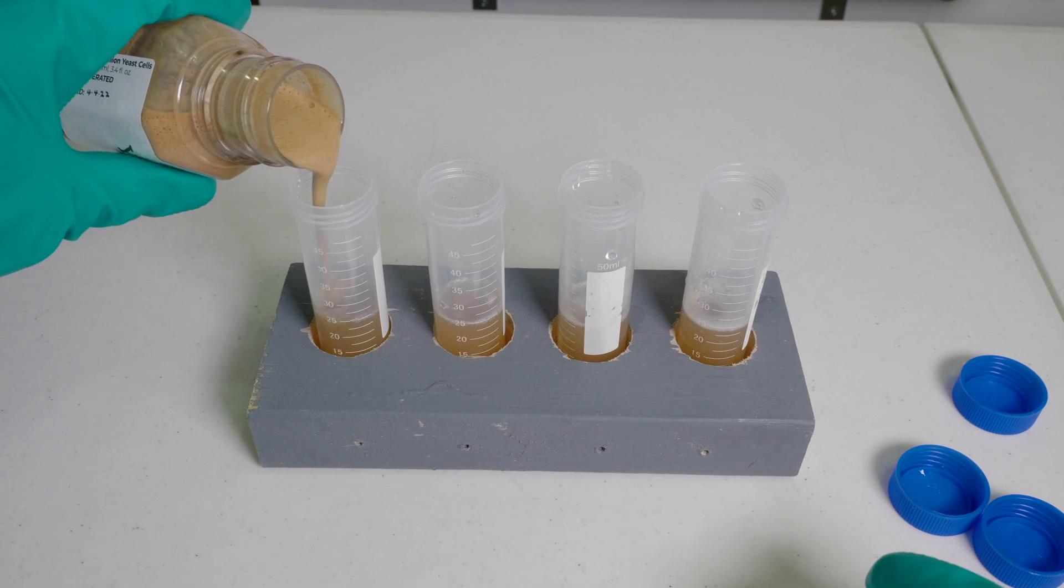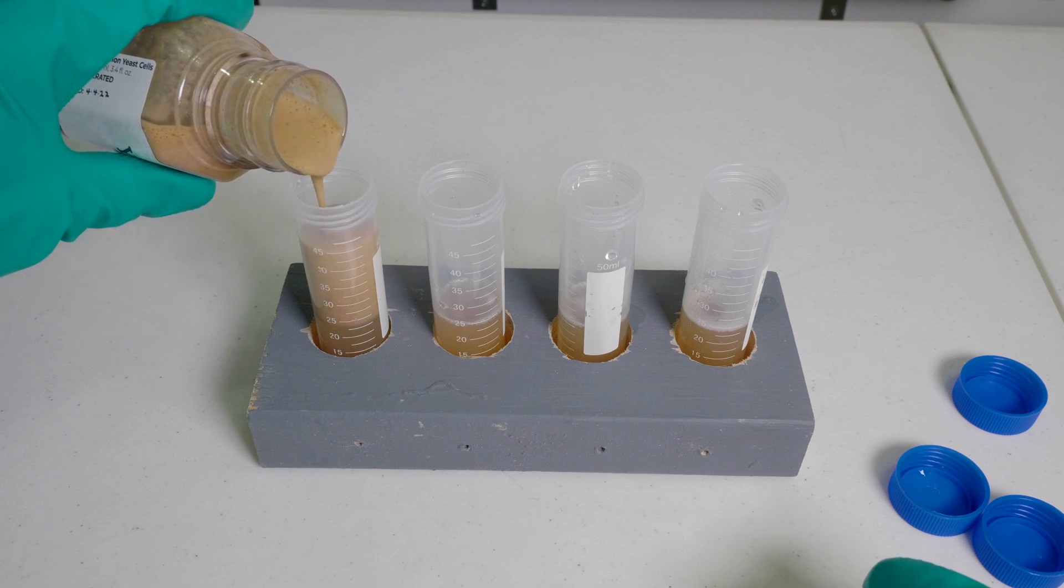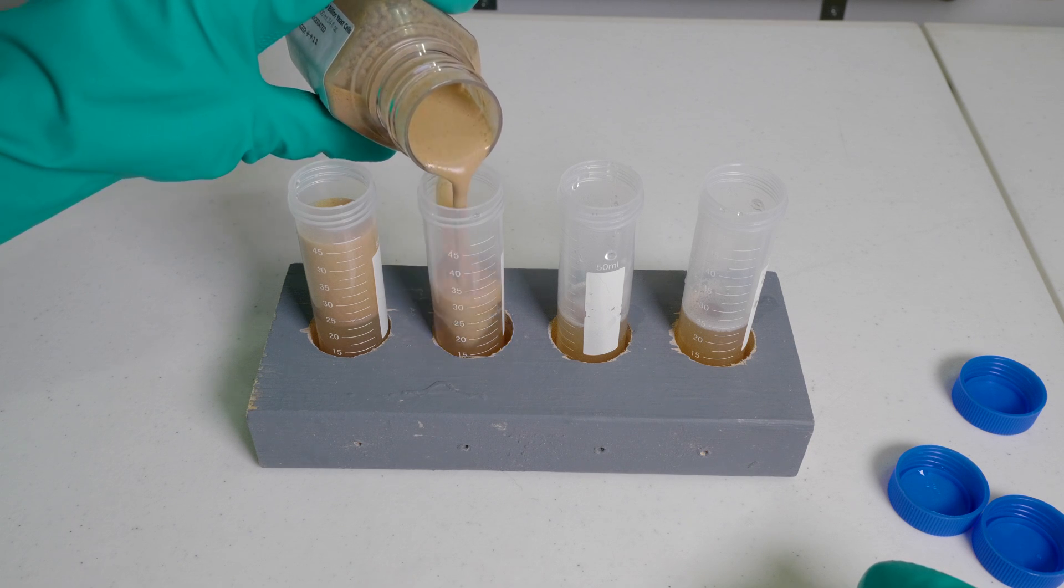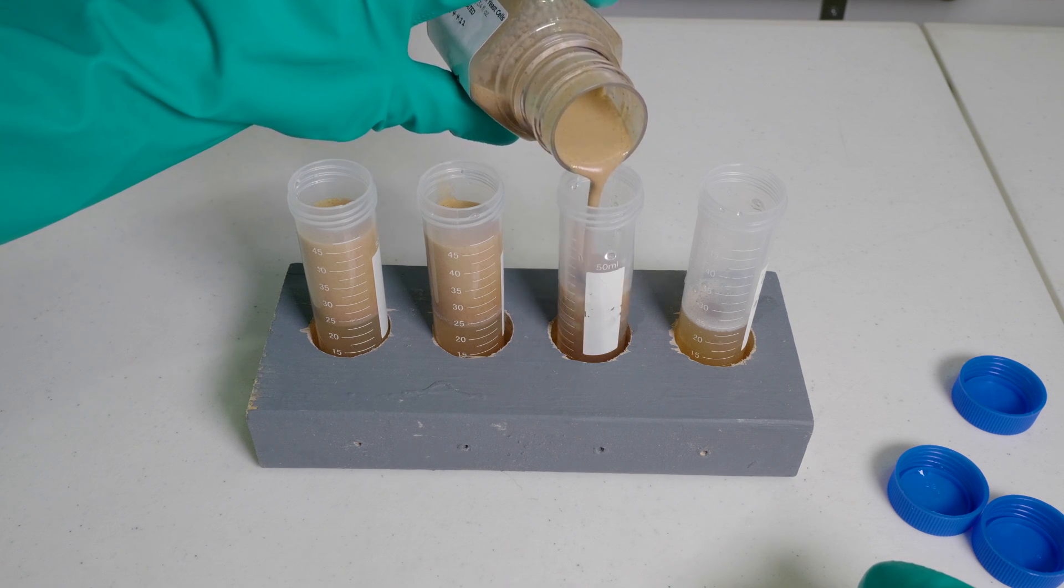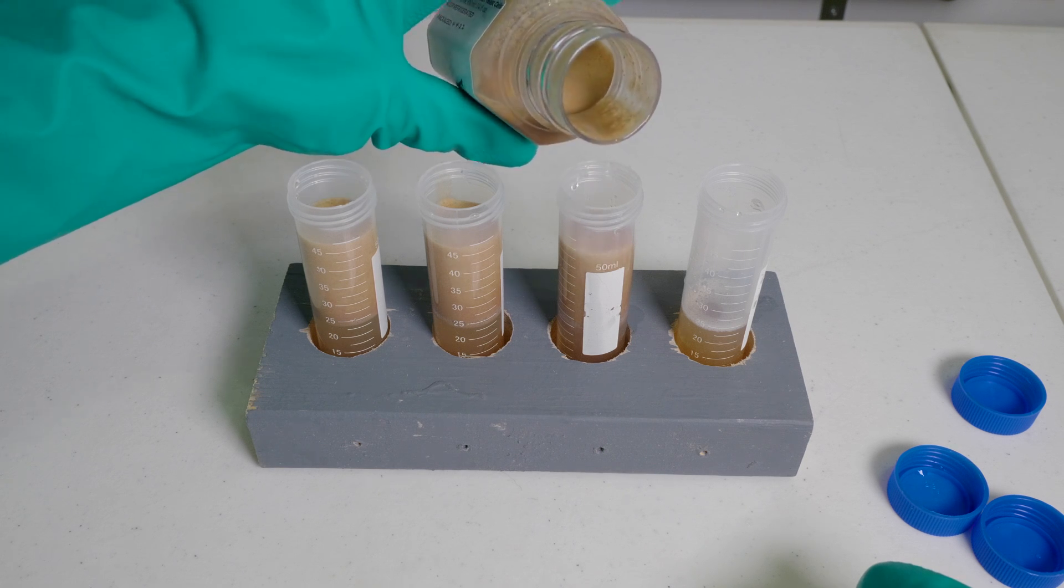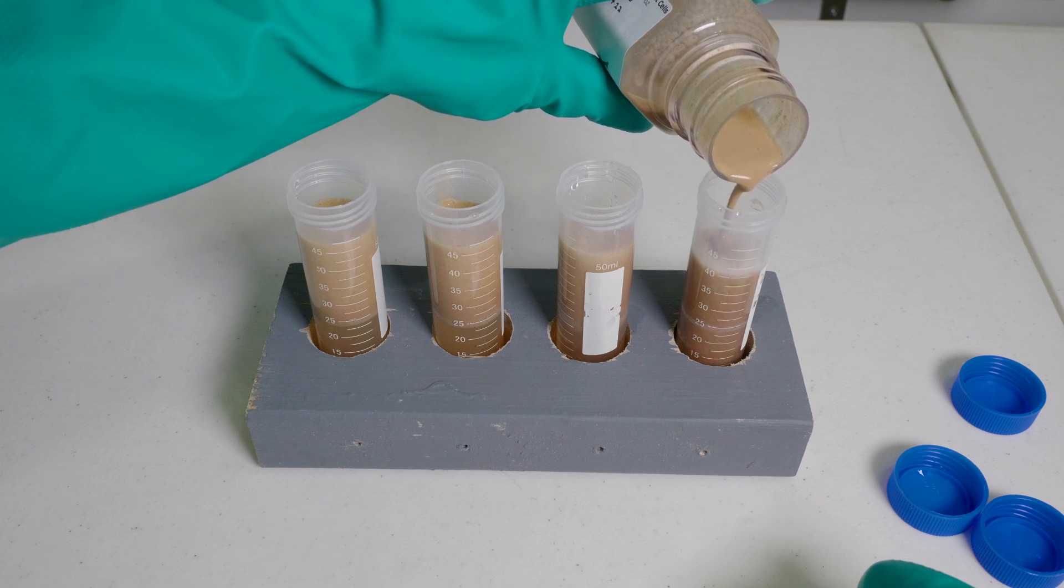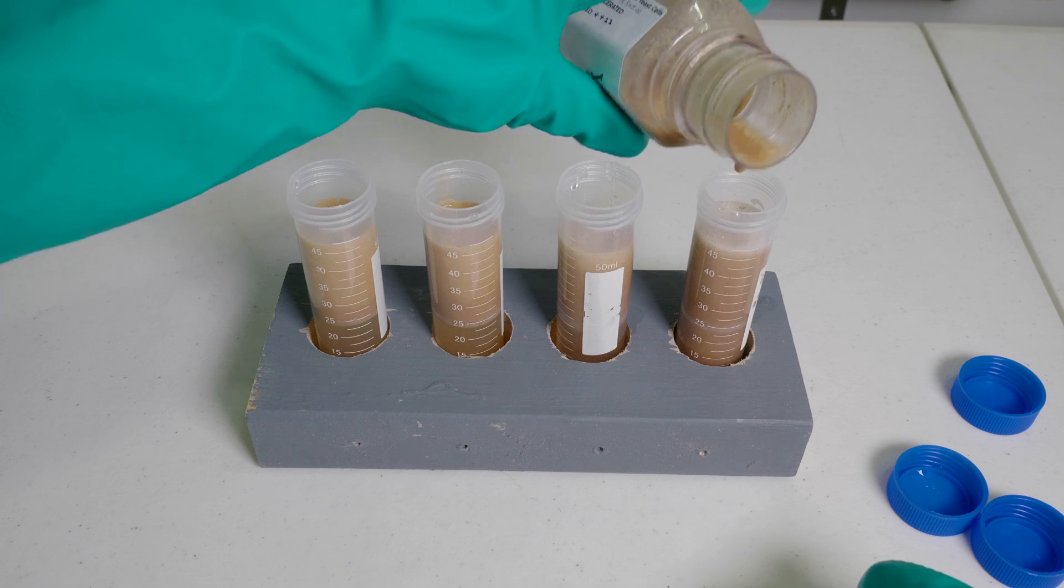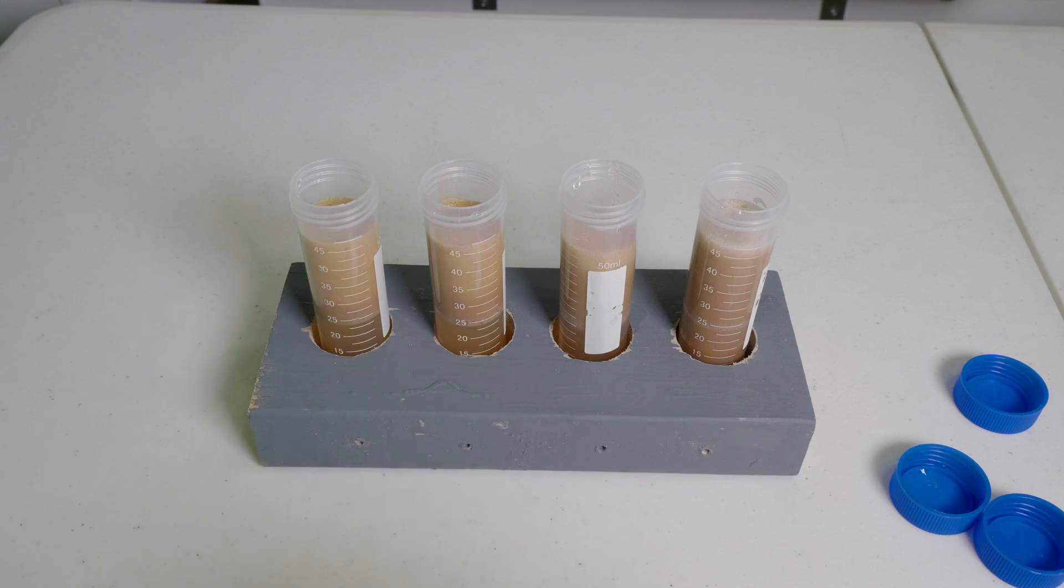Now I'm just going to top up, take it up to the 45, almost 50 milliliter mark. There's one thing I want to point out. You'll see as we get to the fourth vial that I'm actually getting less air and more liquid than the first vial. See how it's darker on the fourth one? You need to sort of let that settle, and then you'll go back and add some more to the first ones.